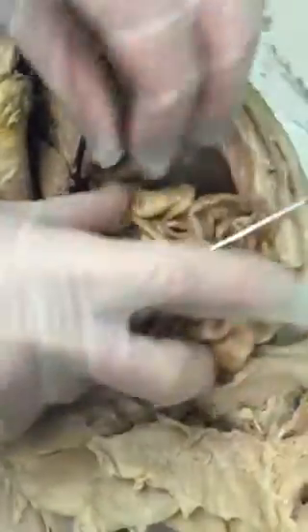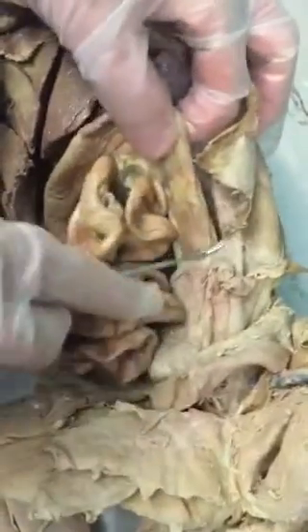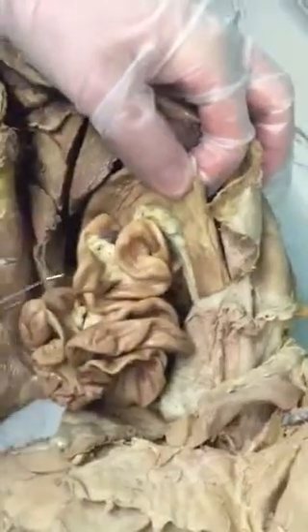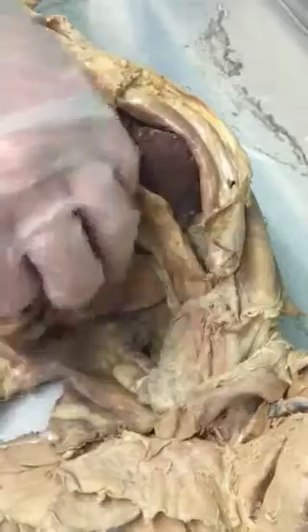This is all small intestine, right below the stomach. And this is large intestine. You have what's called the cecum, ascending colon, transverse colon, and descending colon. So all of this is large intestine. Do you have to differentiate colon from large intestine? No, you can write either word. It means the same thing.